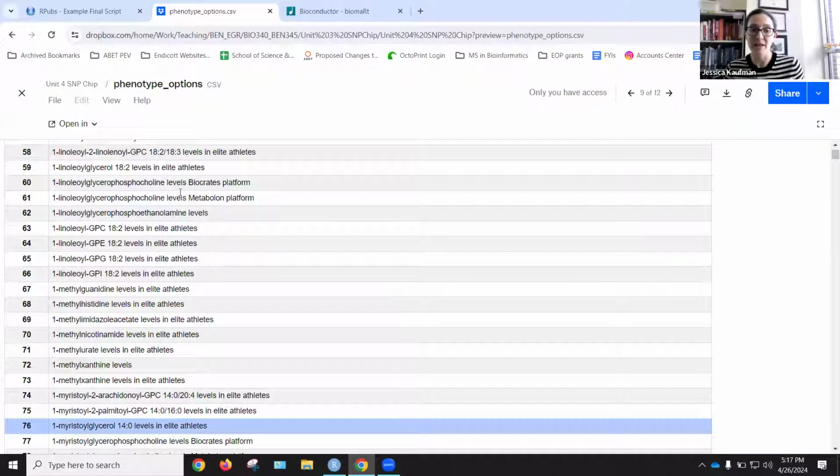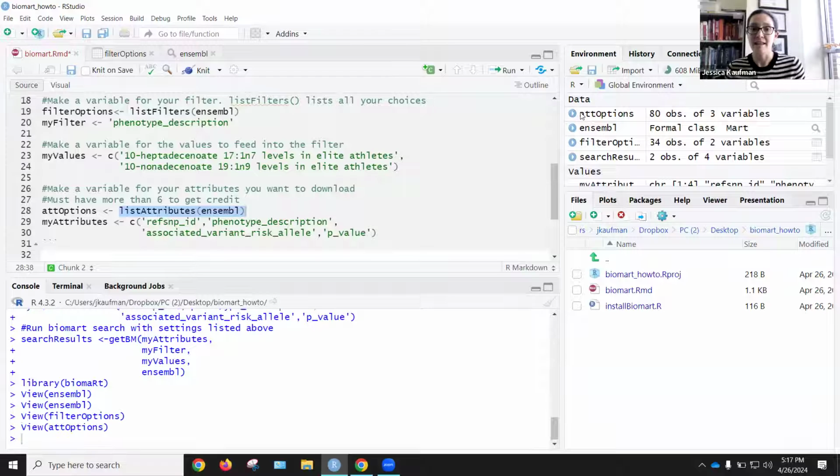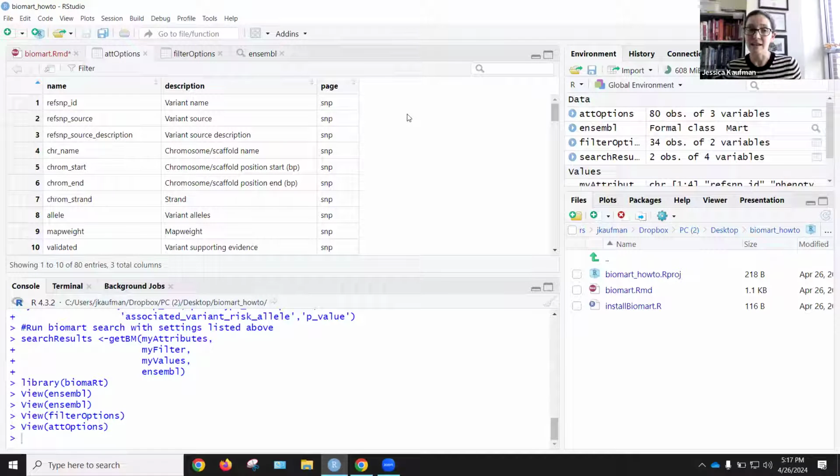Once you have defined your values, you need to define your attributes. Attributes are the columns of data that you're downloading. Again, it's hard to know what all your choices are, so that's why the list attributes command for the mart that you picked is really helpful. I can then look at that variable I created as a data frame and see all the choices I have for information that I can download. So for every SNP in the database, I can get the refSNP ID. I need at least that because I'm going to use that to merge the data with the 23andMe file.